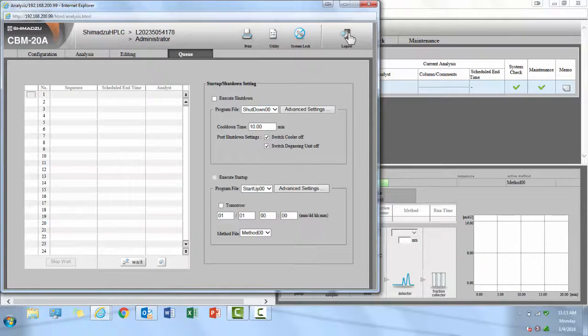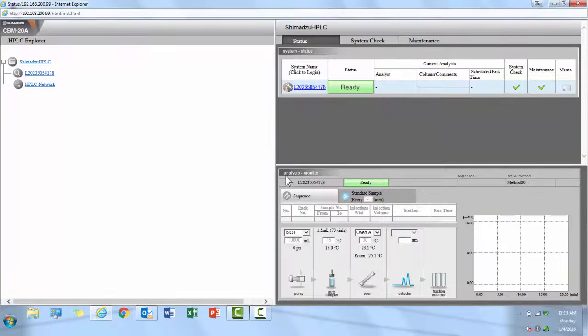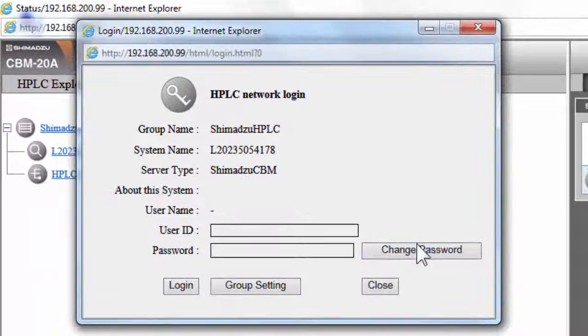The final section we are going to cover is user account controls, known as group settings. To gain access, you will need to select the Status tab, click on the blue hyperlink under System Name. Again, the user ID and password are both admin with a capital A. However, now you will click on Group Settings to log in.